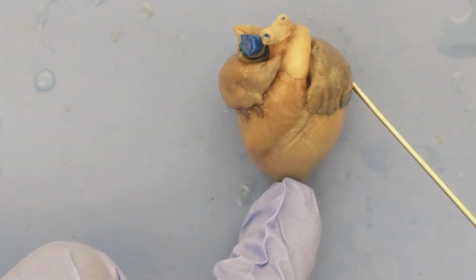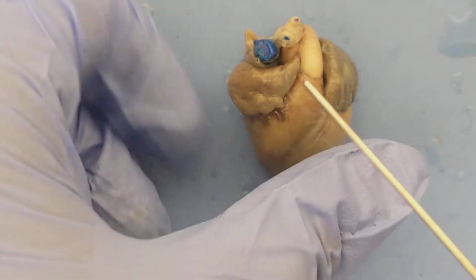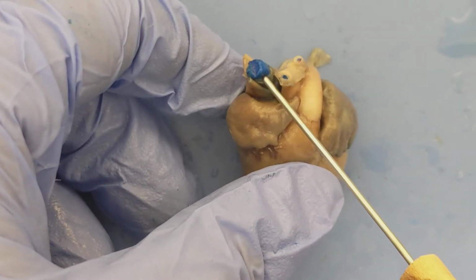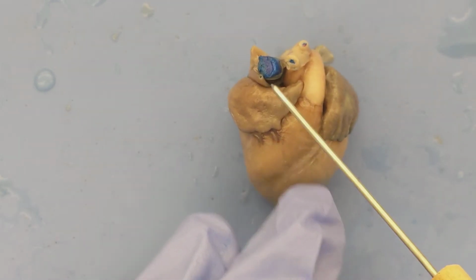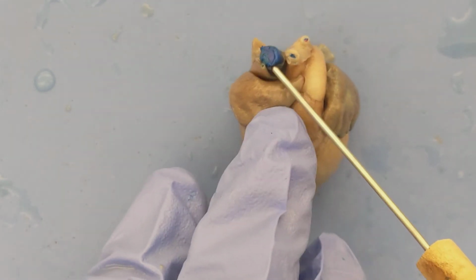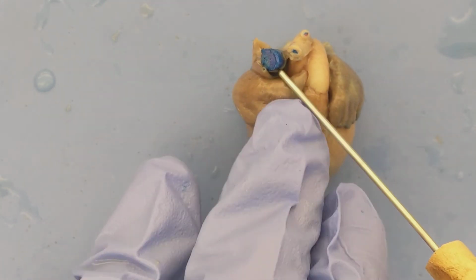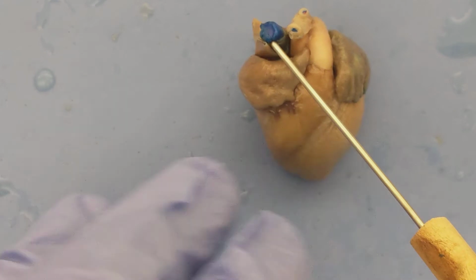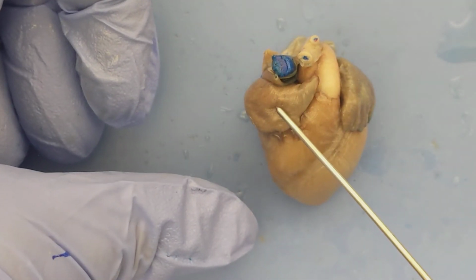Again, the flow of blood through the heart basically occurs when first the vena cava, which is a vein. It's actually here in blue. Some of you may have noticed blue inside the pig. The pigs were dyed with a latex dye, and it turned any deoxygenated blood blue. So the vena cava stained blue here. That's going to carry blood from the body into the right atrium.